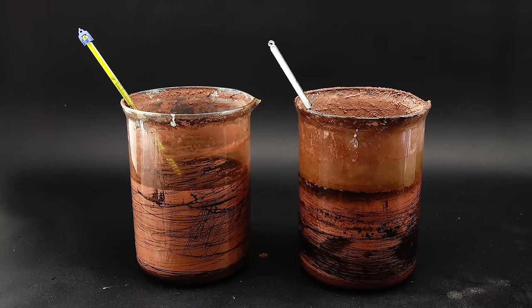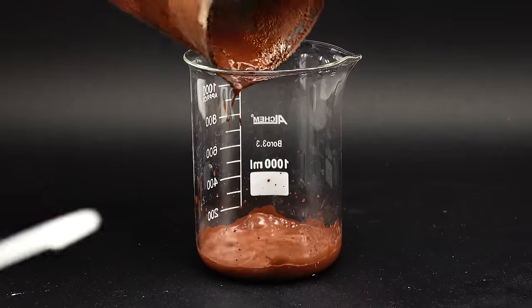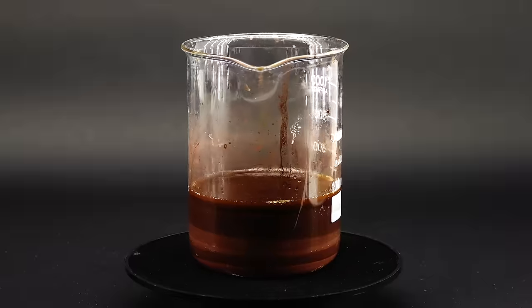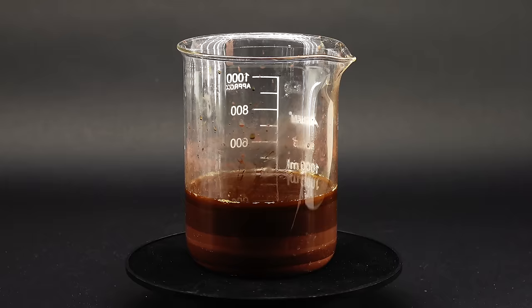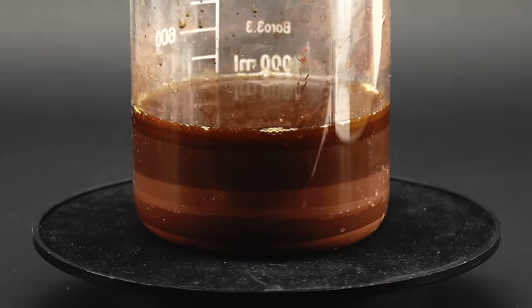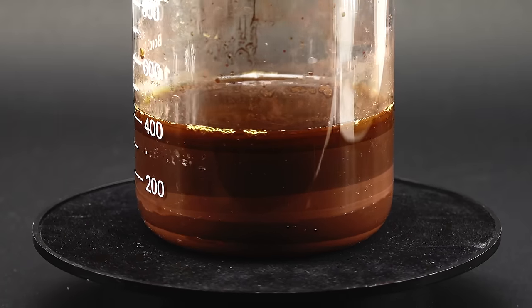Anyway, contrary to the first run, I didn't filter the copper out and dry it, but instead I allowed it to settle out and drain the slurry into a separate beaker. When I was done, I was left with quite a bit of this copper slurry, and you can actually see that I did seven runs, because the powder from each has a slightly different color, and creates a separate layer.